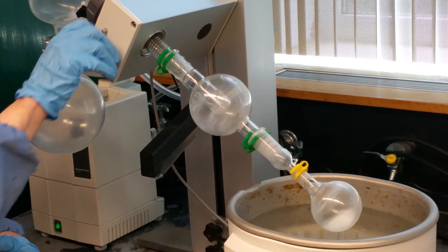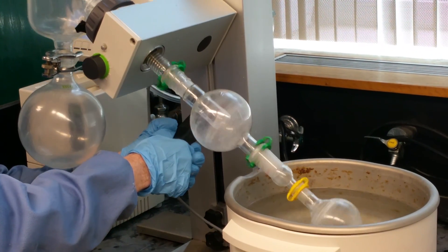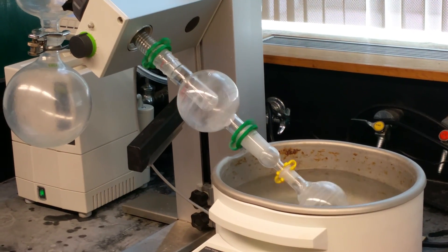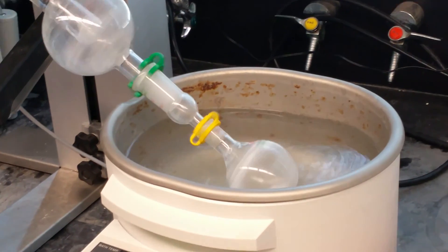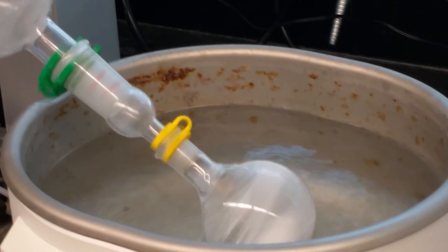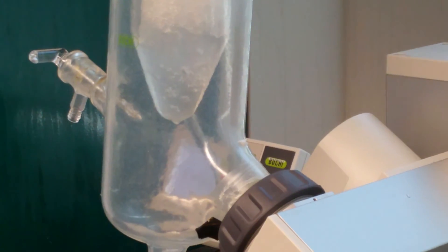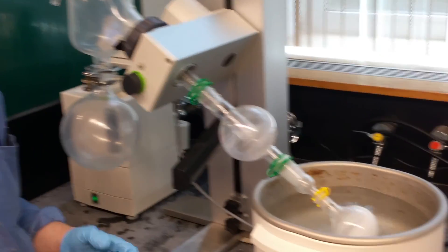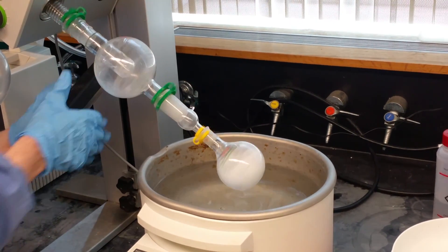So how do you start? Let's just do it again. Hit the button. Hit the start button. Close this. I didn't do that. Turn this on. It didn't bump, thankfully. If you do it quickly, it doesn't usually bump. Sometimes when it's too full, it does that. Lower it into the liquid. I'm going to let it go to dryness. So it's start, close, lower it in. It's coming down to dryness. It's distilling now. You can see it distilling again. It's like you're seeing the whole thing over again if it didn't make sense. Now I'm going to—it's dry—so we've rotoed up into dryness.